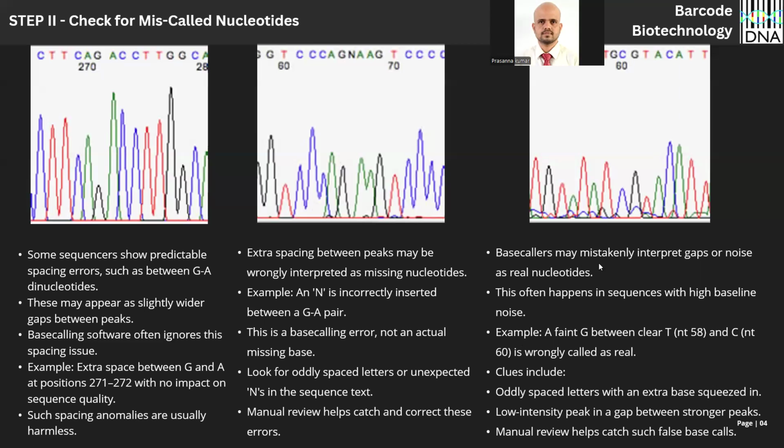Sometimes they can also mistakenly interpret the gaps or noise as a real nucleotide. Okay. Here in position 58, almost here. We have a thymine at 58. There is no peak at 59. Okay, 60 is cytosine. Why is there a guanine here? Not necessarily. If there is a guanine, it should be like this.